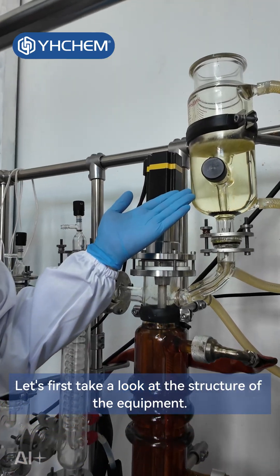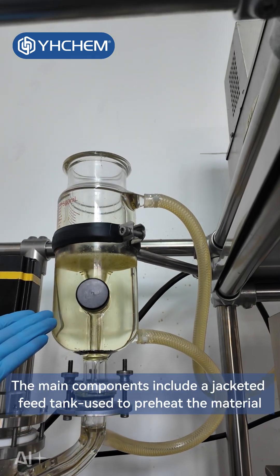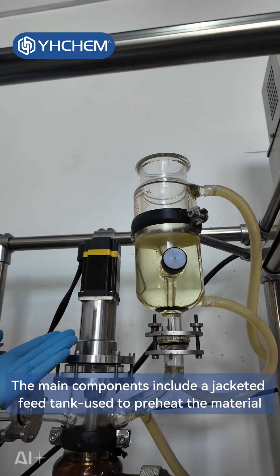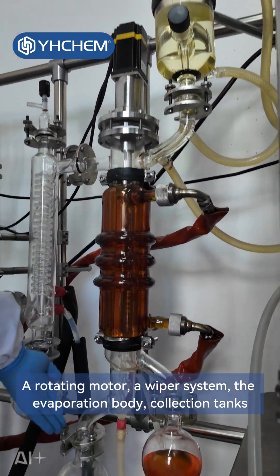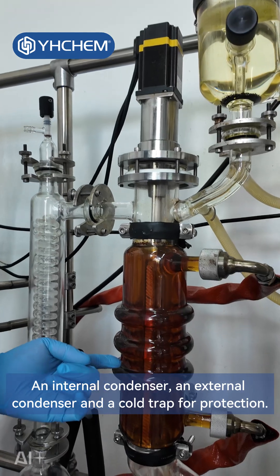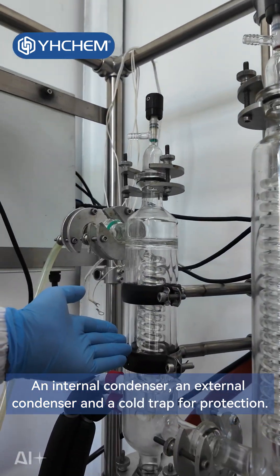Let's first take a look at the structure of the equipment. The main components include a jacketed feed tank used to preheat the material, a rotating motor, a wiper system, the evaporation body, collection tanks, an internal condenser, an external condenser, and a cold trap for protection.